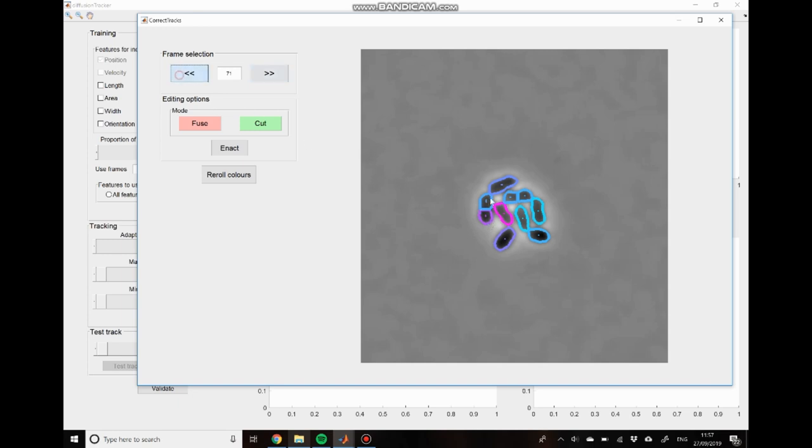So what we need to do is we need to cut this track at this time point where the division takes place. To do that, we just cut, click on the mother cell, we click enact, and then it's done. So that's cut the track into two separate parts, one corresponding to the mother and one corresponding to the daughter. And if we click over to the fuse module again, you can see that we have this nice archetypal division type event. So we have this nice cyan outline with a dark orange band in the middle. So I'll just continue going through in the cut module, finding events that need to be cut, and I'll get back to you shortly.